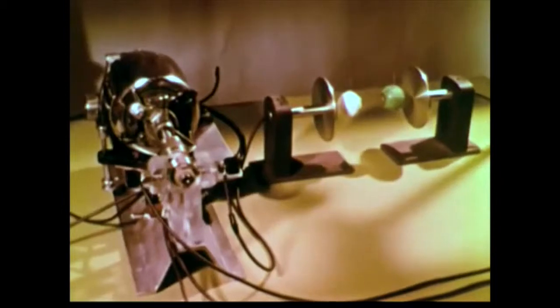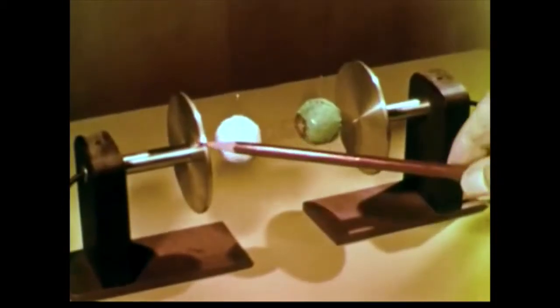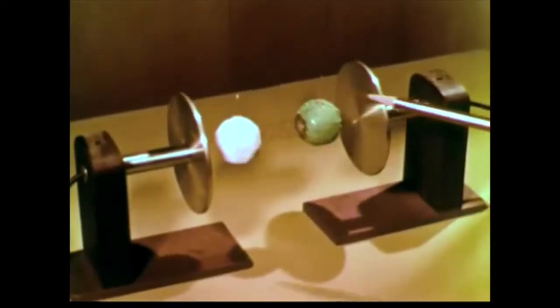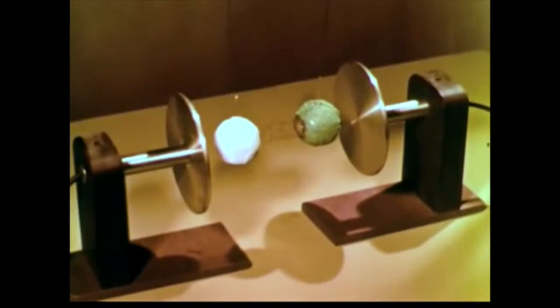We can reproduce this condition by using an electrical generator to charge two condenser plates. With one charged positively and the other negatively, we can switch the charges back and forth and simulate the oscillating electrical effect of a light wave. To model the hydrogen chloride molecule, we can use two lightweight spheres connected by a spring.